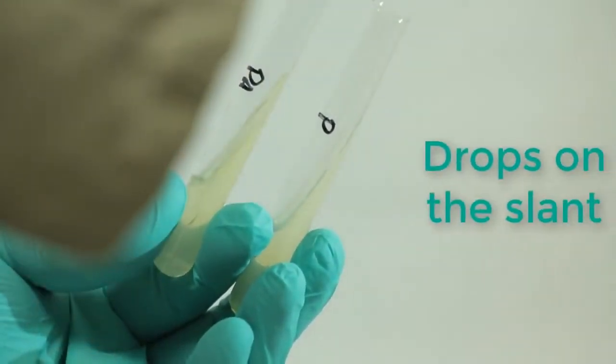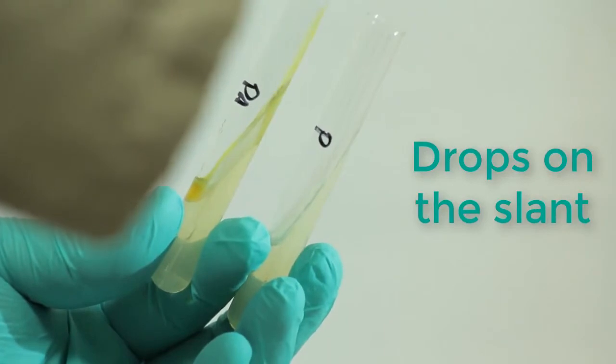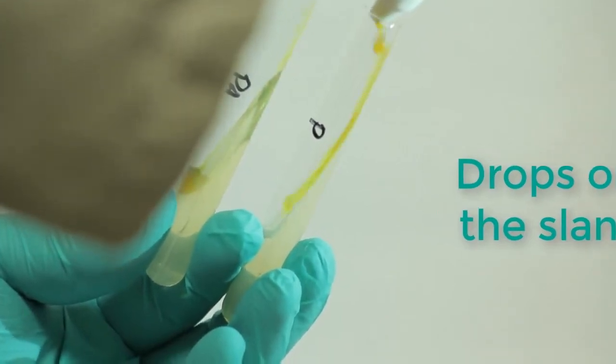In order to add the reagent, you simply drop several drops of reagent onto the slant of the tube, and this may take up to three minutes to react.